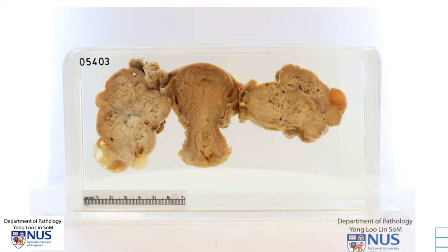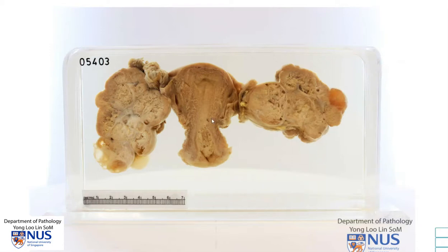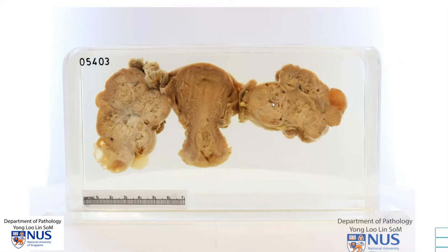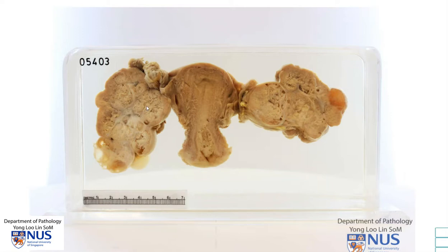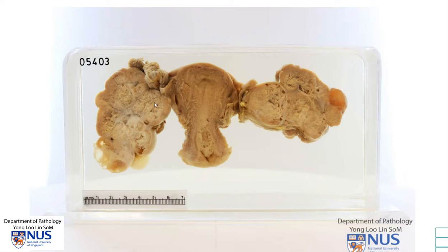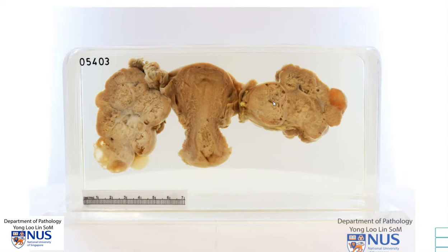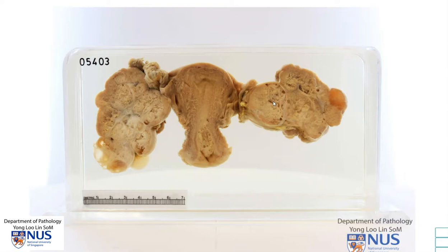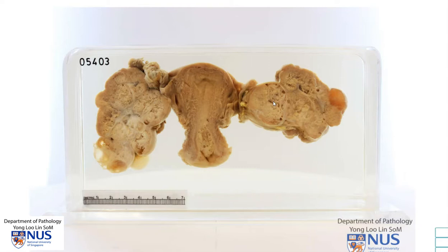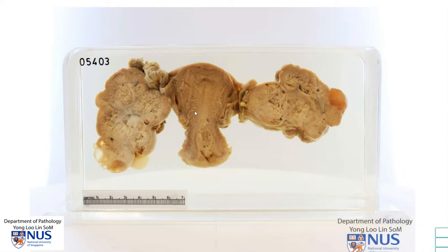With a gross appearance like this, with bilateral ovarian tumors, the main differential diagnosis would be primary tumors of the ovary versus metastasis to the ovary. So it is important to look at the past history or any known history of malignancy in this instance.